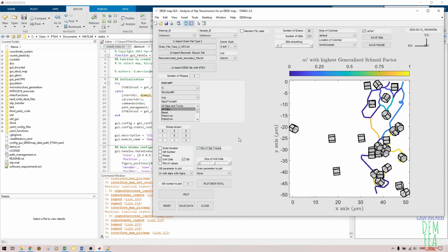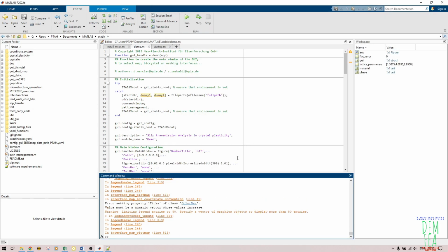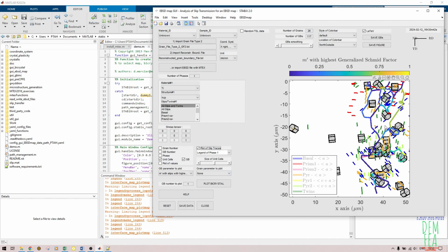You might think they are not, but they are. So if you do plot of slip traces like that, so if I change this, you will see there will be some changes here. So let's say like that. As you can see, let's see if we get some changes. I don't know, the same thing. So let me see. Yeah, as you can see, there are some differences.